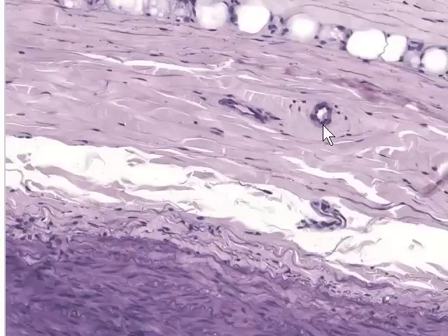Again, here's an arteriole. I can tell it's an arteriole because it has an endothelium and only one layer of smooth muscle surrounding it. Anything less than 5 layers of smooth muscle is an arteriole rather than an artery. And you can spend some time looking around the wall of the vessel and observing what you can see. For example, there's a venule right here.